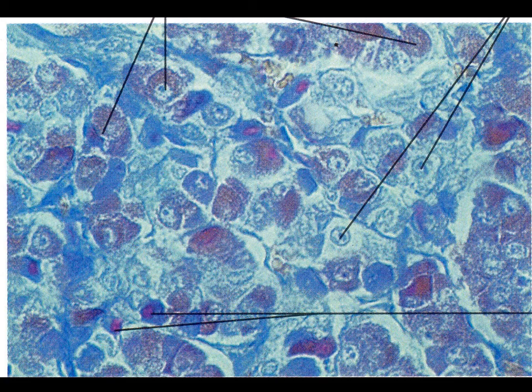We're going to take a look at the histology slides that we need to know for the endocrines as well as the white blood cells. And so here we have an image of the anterior pituitary. Anterior pituitary has three different kinds of cells in it. And so we have acidophils, basophils, and chromophobes. And the cells themselves kind of go along a general pattern.